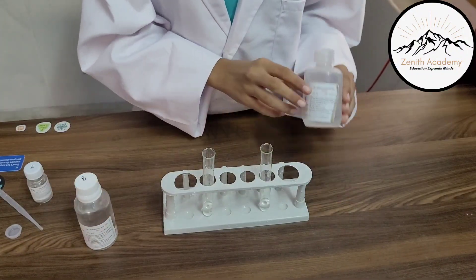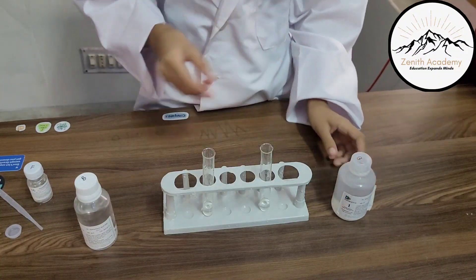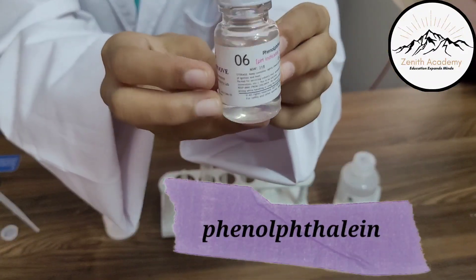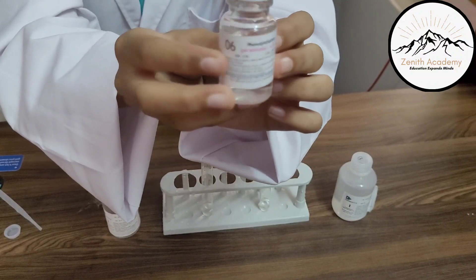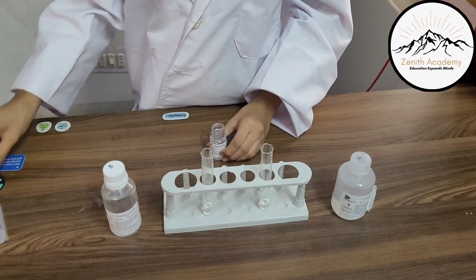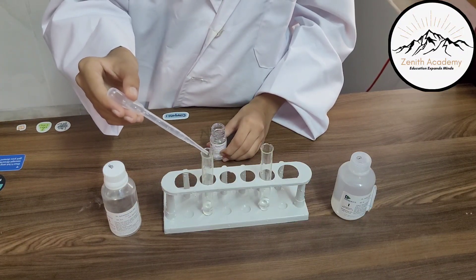In this test tube she has taken dilute sodium hydroxide, which is a base or an alkali. Here is the phenolphthalein indicator — our magic indicator. Now let's take some drops of phenolphthalein indicator and add them into both of the test tubes and see the color change.